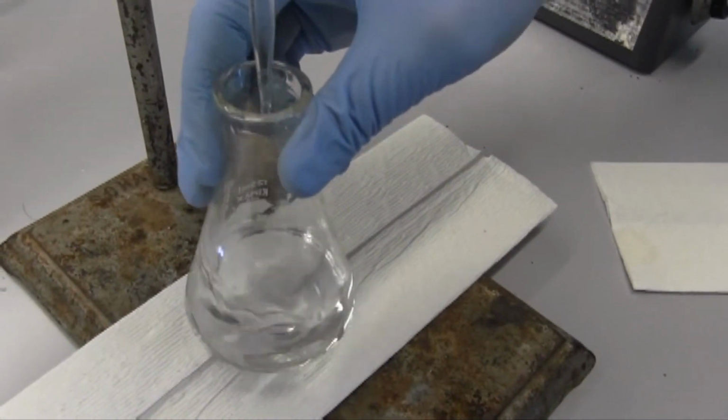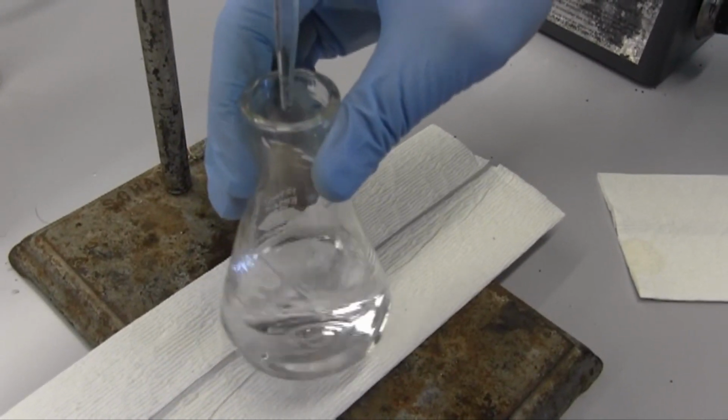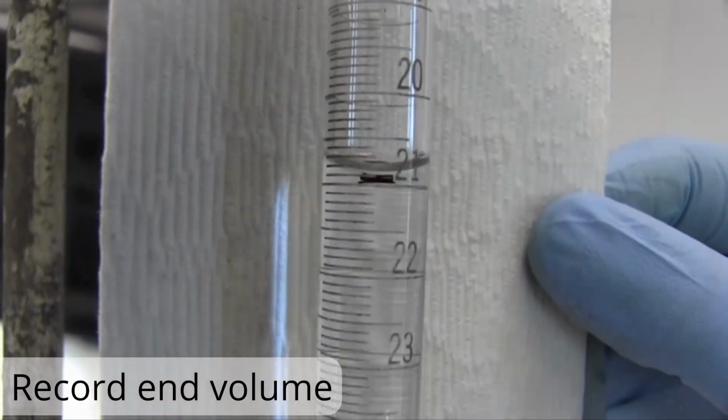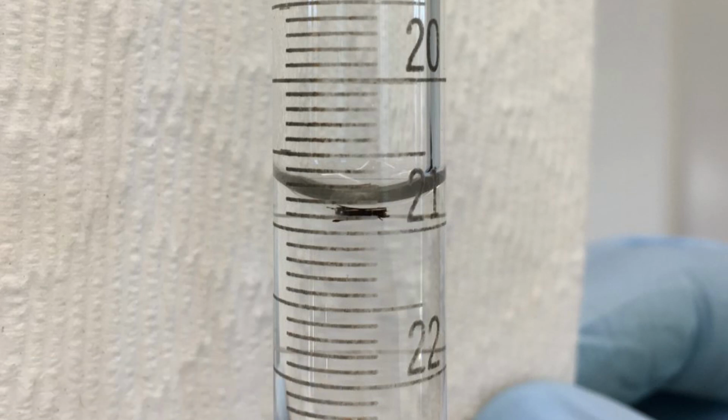And we'll slowly swirl. And there we go. We've reached the endpoint. Go ahead and record the final volume in your notebook as well. And we've done our 2 trials.